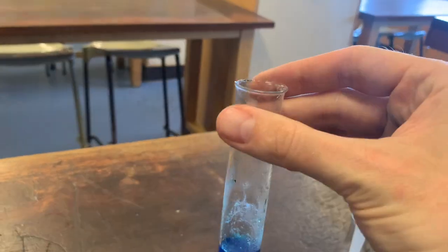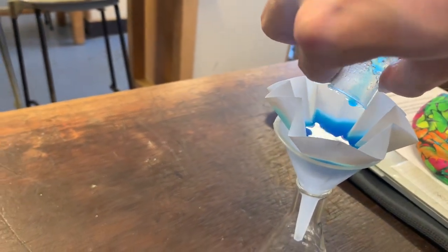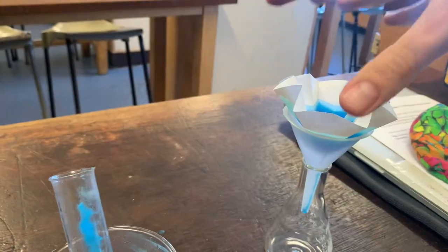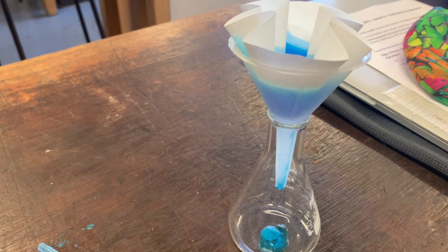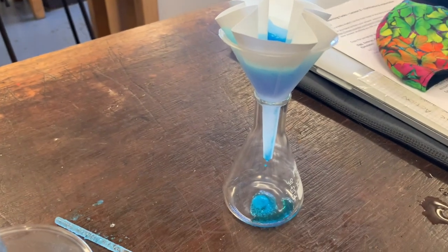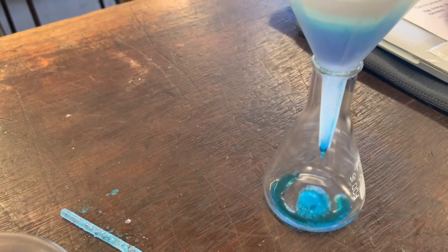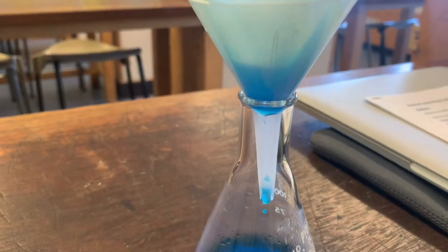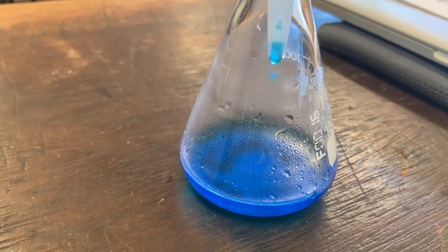Let's just take this out and carefully pour this in here. And we will let that drip through my funnel. It's cooling down quite a lot — we might need a little bit more water on this to get it to come through. But you can see that this filtrate, the bright blue filtrate there, that is my copper sulfate solution. You can see here that it's filtering through really nicely and it's nearly at the end — we've got a lovely little amount of solution at the bottom.